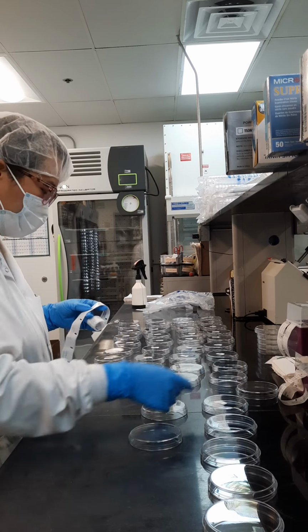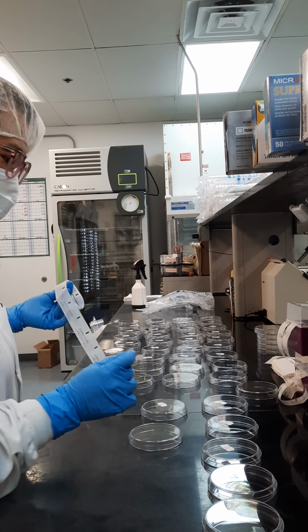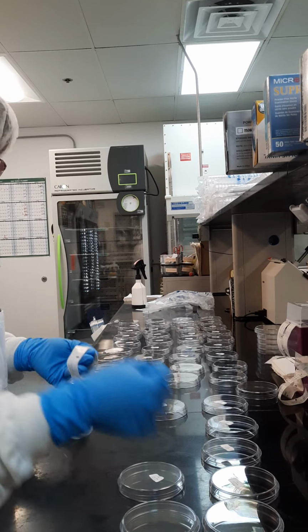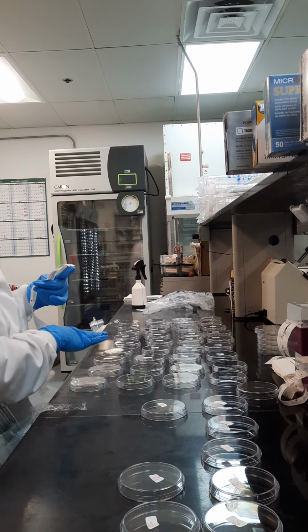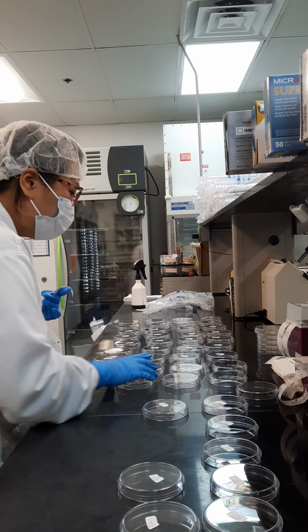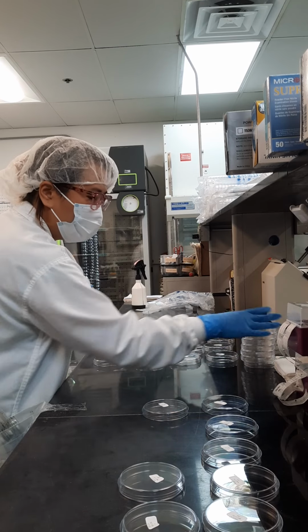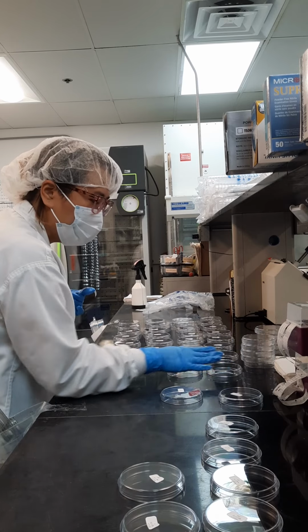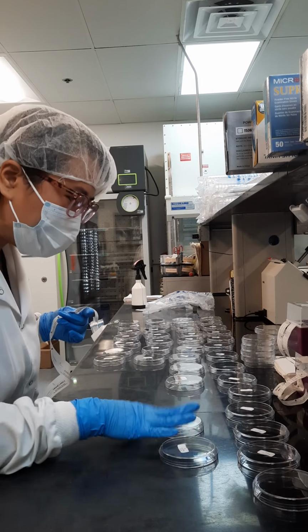C5, HD. So, extra plates. Better to have more plates than not enough. That's what I like to say. Especially when things are time sensitive.